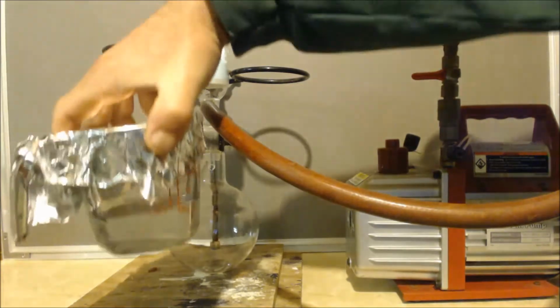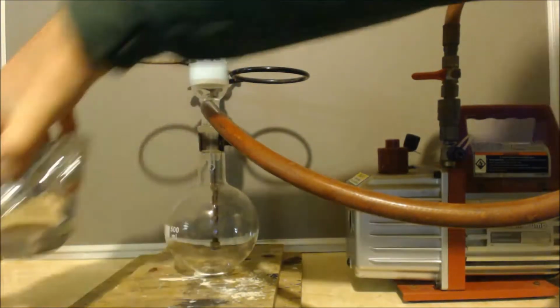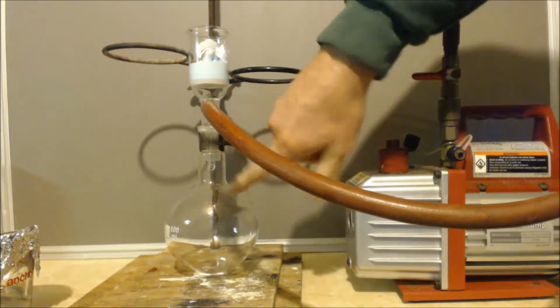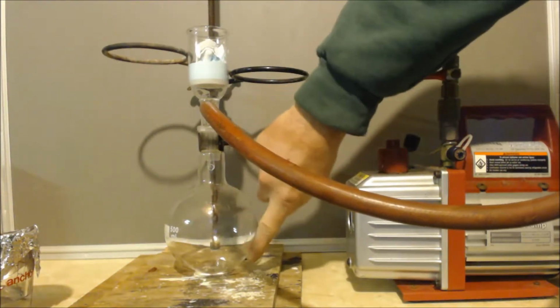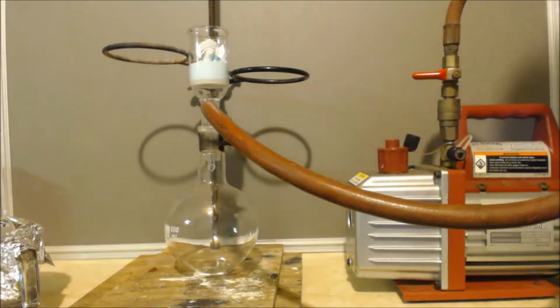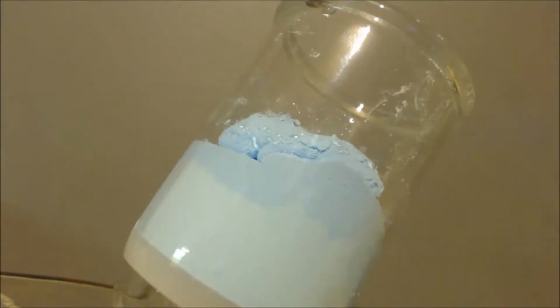Alright, now I dumped that into this cup here because I didn't want this to evaporate, putting a vacuum on this. Then I kept the vacuum. You can see I got about another 10 milliliters in there. So I got about 75 milliliters in there, plus say 10 in there, that's about 85 milliliters. I did a density test. It was 0.78, and the density for it should be 0.786. So it's pretty anhydrous.